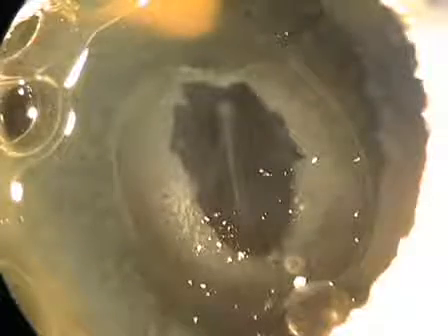Today I'm going to be talking to you about how to perform chick in ovo electroporation, and we will be electroporating Hamburger and Hamilton stage 10 chicken embryos, which is about two days of embryonic development in chick.